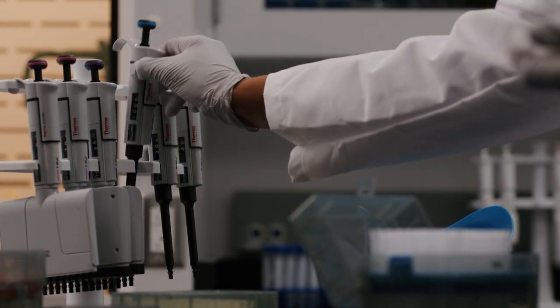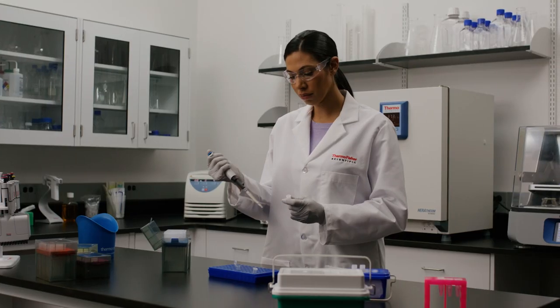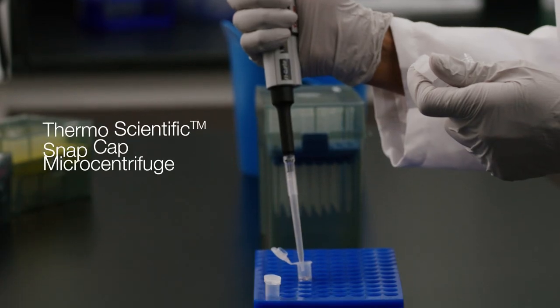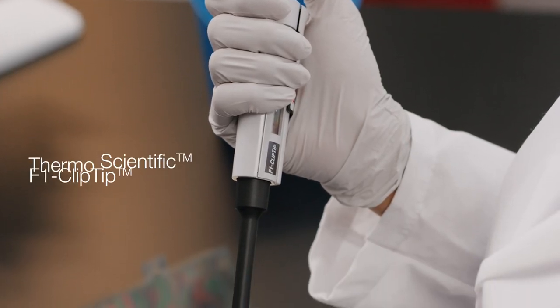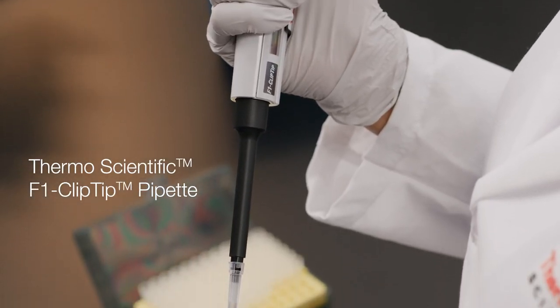Next, she mixes plasmid and chemically competent cells by pipetting them into a ThermoScientific SnapCap microcentrifuge tube. And of course, she's using a ThermoScientific F1 ClipTip pipette.